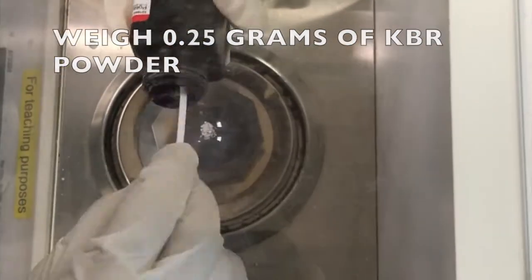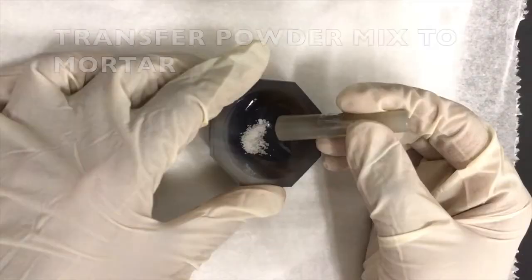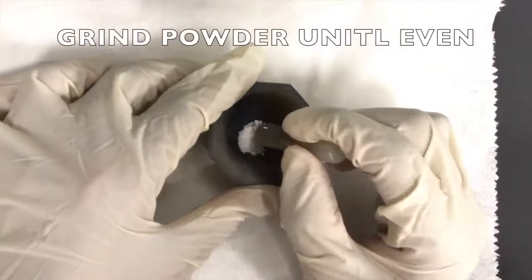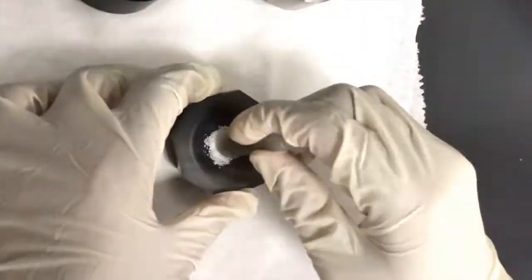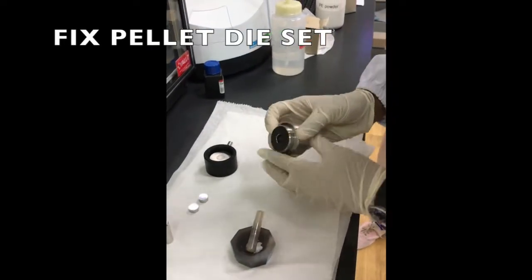Powder can be placed in the oven if there are traces of moisture in them. Now, grind the powder till a homogeneous mixture of even powder size is achieved. Ensure powder is not too small as KBR is hygroscopic and will absorb moisture from the surroundings.